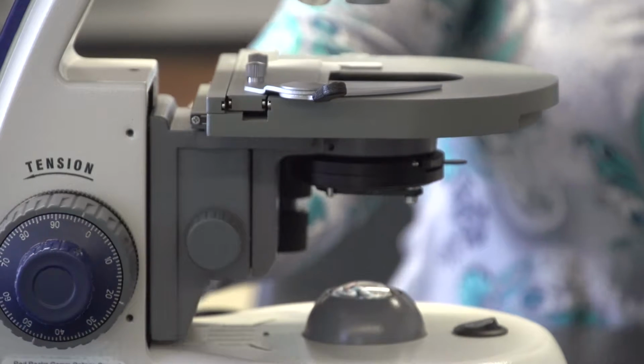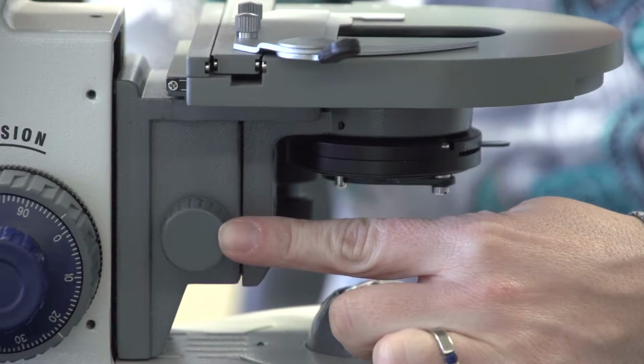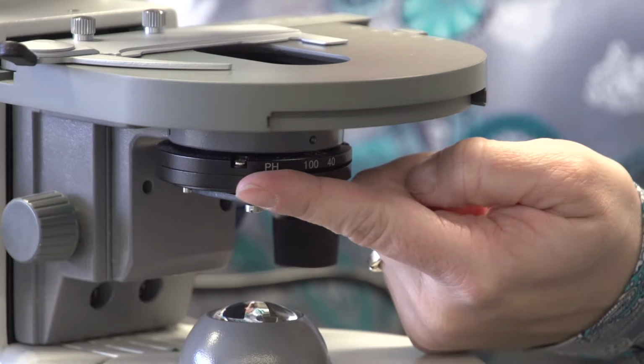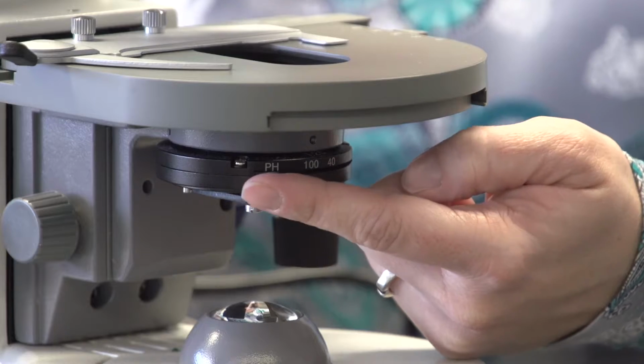The other thing that's important to look at on the scope is the stage, and we can move that up and down with the coarse focus knob. It's how you're focusing the microscope. The condenser is down below the stage. It's responsible for focusing the light through the microscope. That can be moved back and forth. I suggest you keep that all the way up so it maximizes the amount of light going through the scope. This lever here is the iris diaphragm, and you can move that back and forth to allow different amounts of light to come through this microscope.